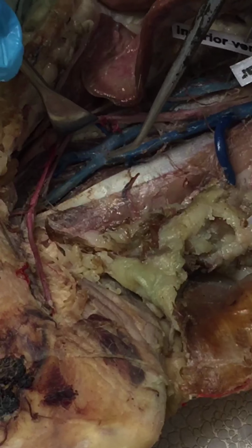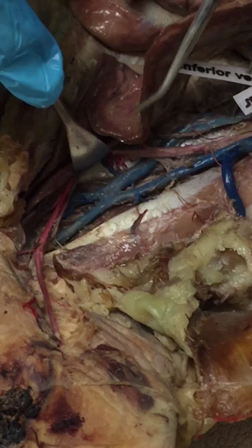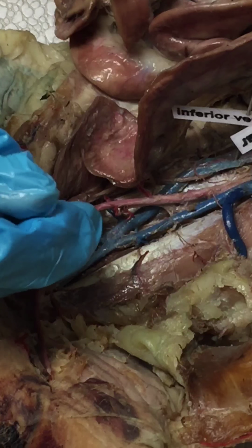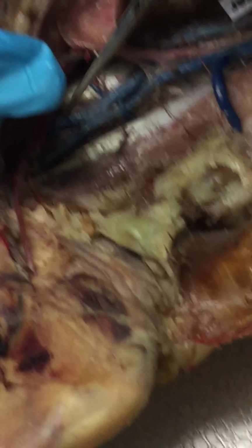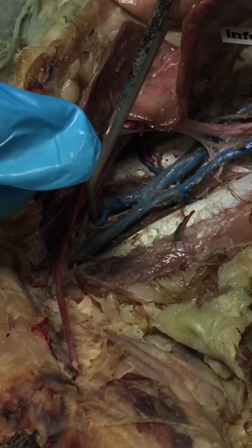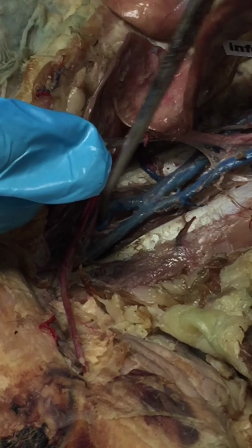So this is where the inferior vena cava ends, right? Then it starts your common iliac, then the external iliac. The way you differentiate between common and external is that little guy right there. Can everybody see that? Yes. Can you see? I'll flip it back around for you. That is the internal iliac.